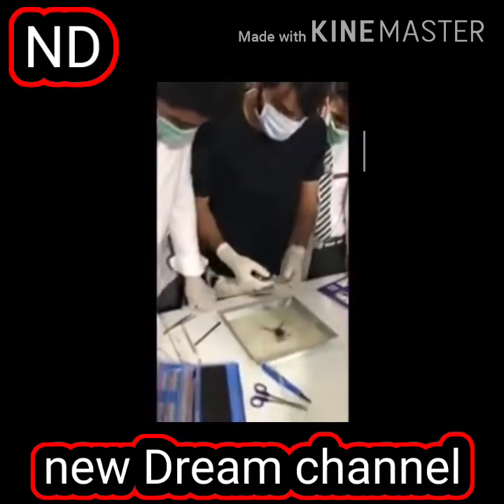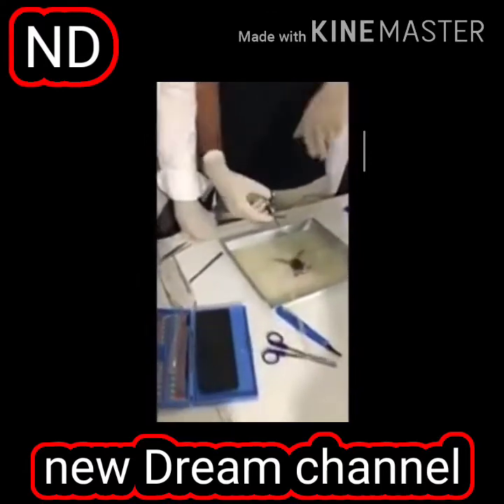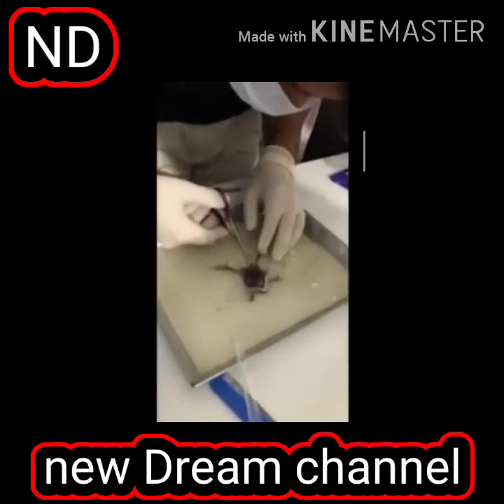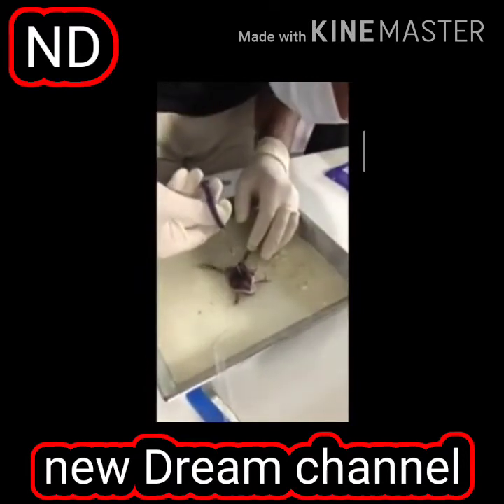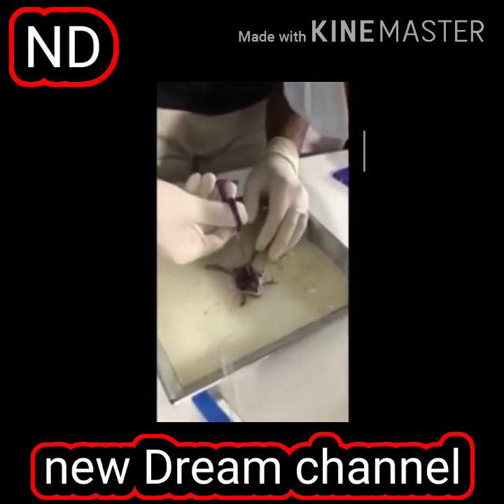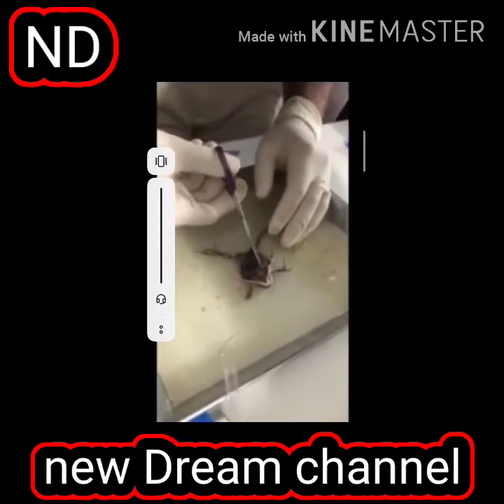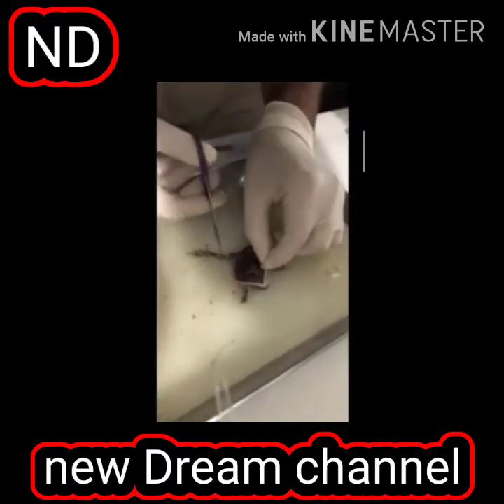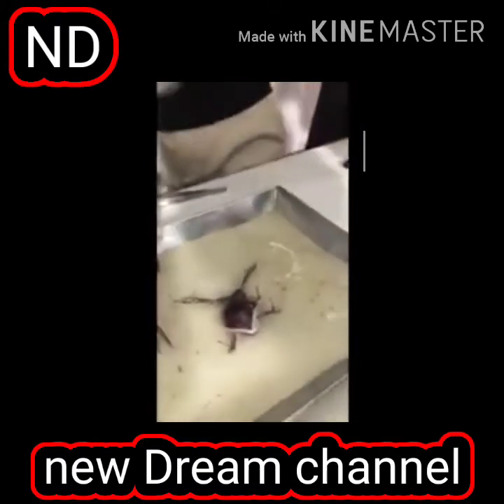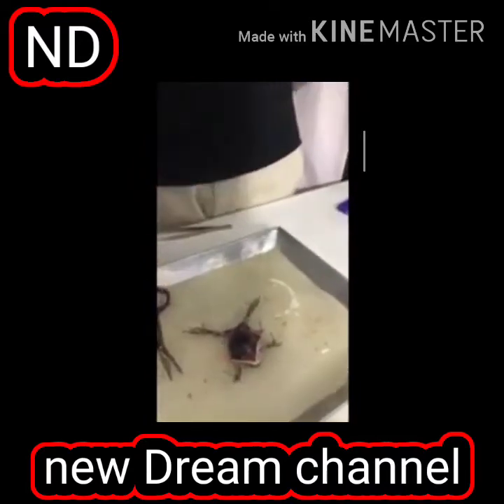Now let us try to just imagine it more. I can show you the heart of the frog. I'm cutting it. Anybody have your mobile and then show the light on it? Anybody have mobile? Yes.